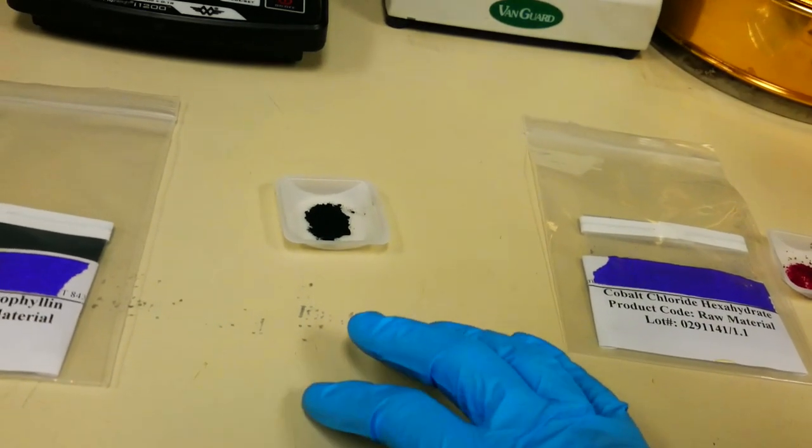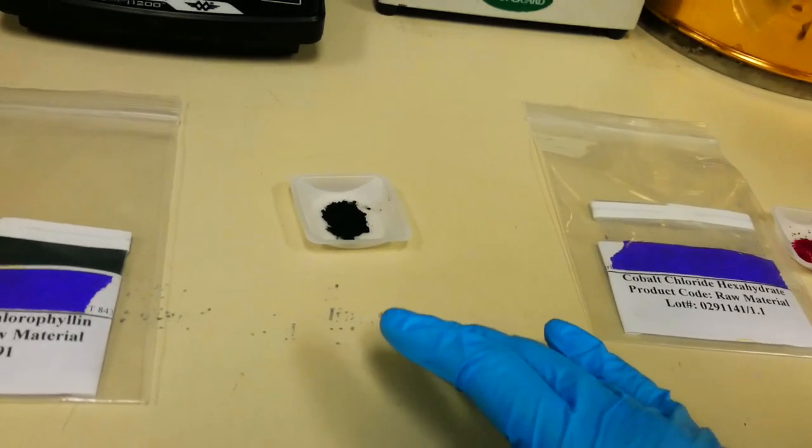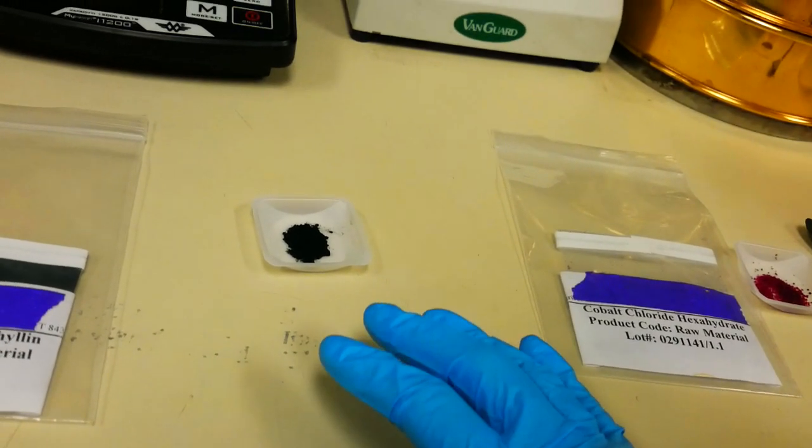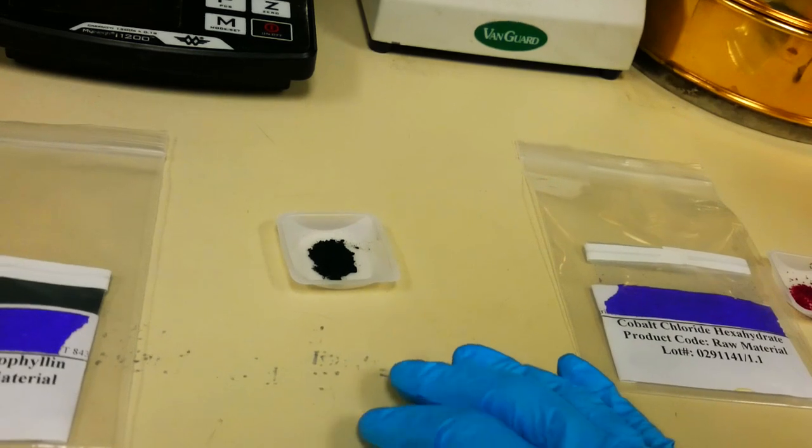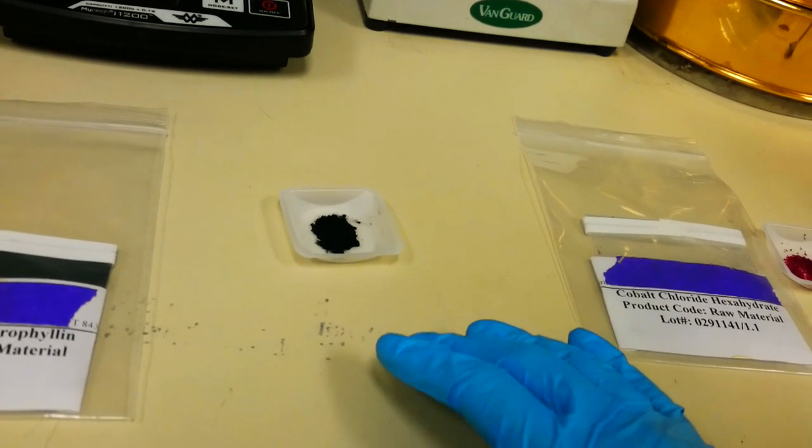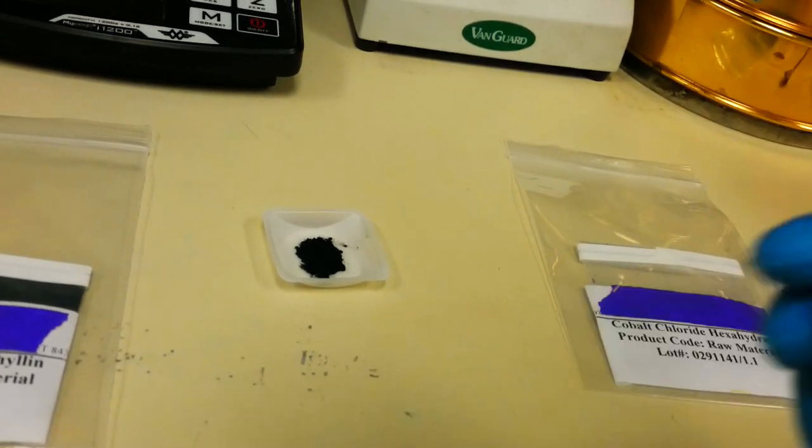Hello there. I'm in the lab today with some interesting materials and I wanted to show you their properties.